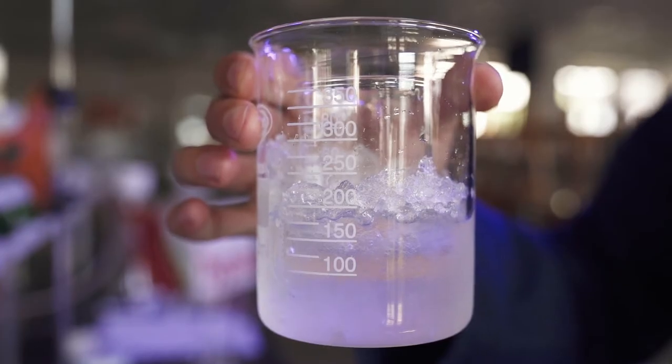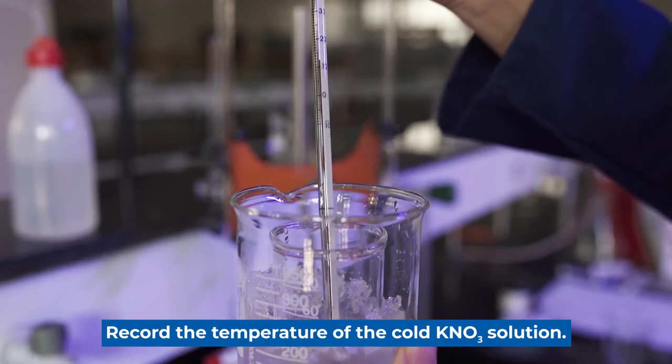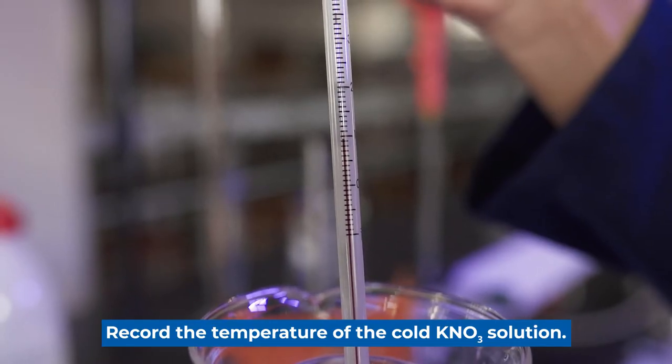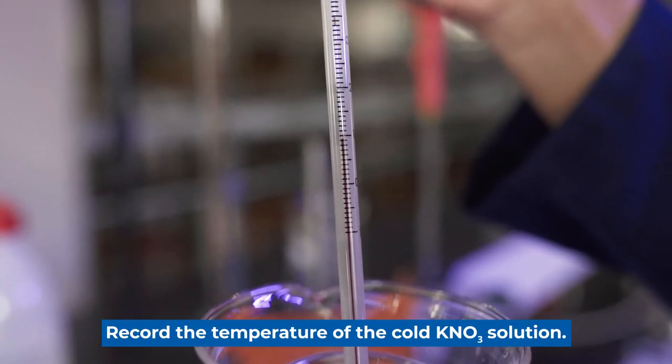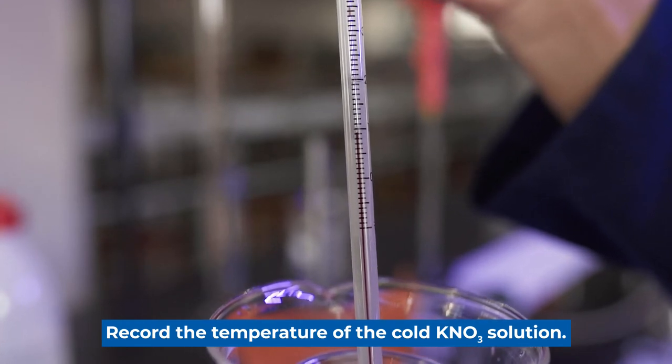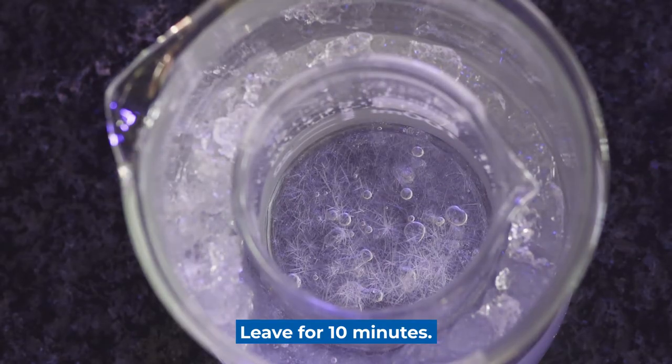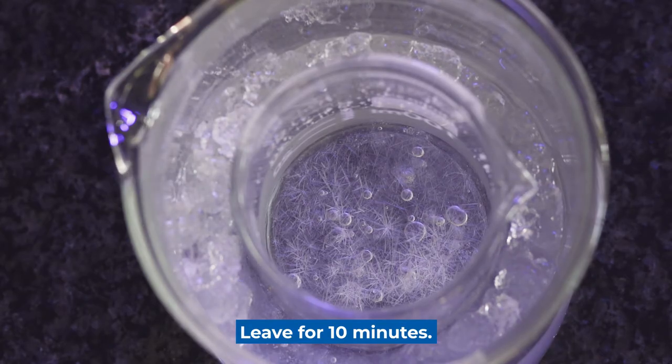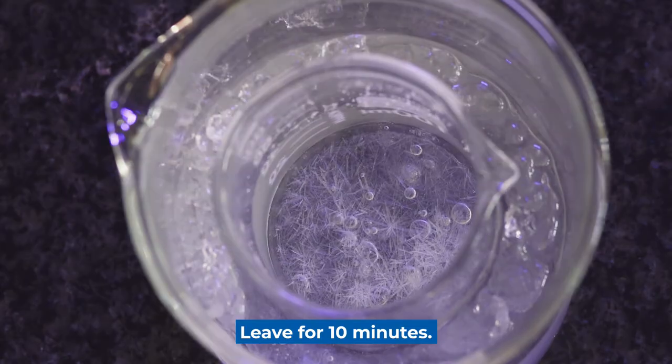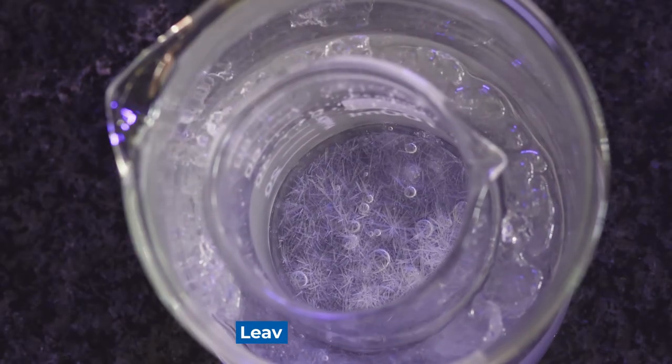Once this is done, we need to measure the temperature of the solution as recrystallization is initiated at this point. The temperature needs to be stable for about 10 seconds. Once the solution is placed in the ice bath, it needs to be left undisturbed for about 10 minutes to ensure that the crystals can form evenly.